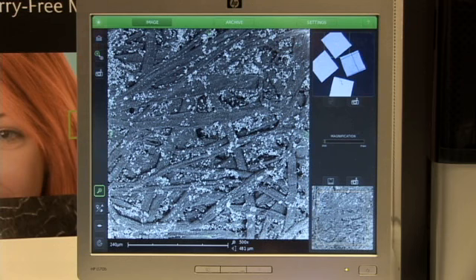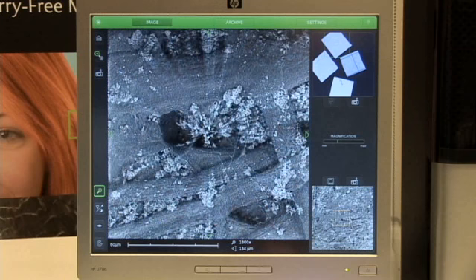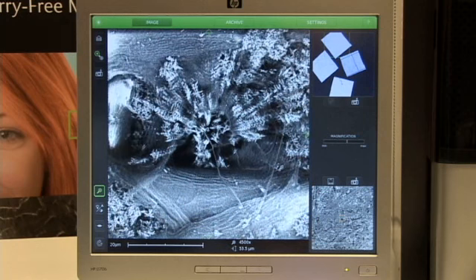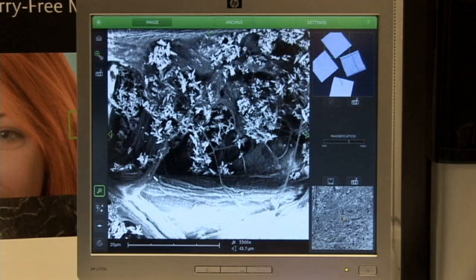That is depending on the application and the magnification. And it's best to show you with an example which we have here inside the Phenom. So we're looking at a magnification of 500 times onto a piece of paper, so it's plain paper. And if I start to zoom in more, so increase the magnification, there will be a certain point that the number of electrons is that high that they cannot fade away properly and result in a white screen. And at about 5,000–6,000 times magnification, as we see now, the white spots, which is charging. Okay, I see what you mean.